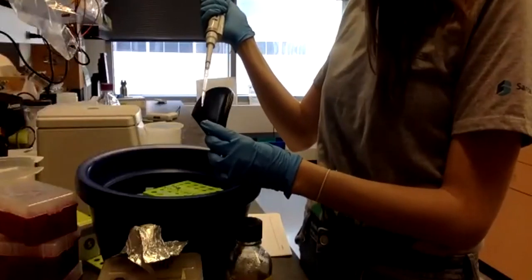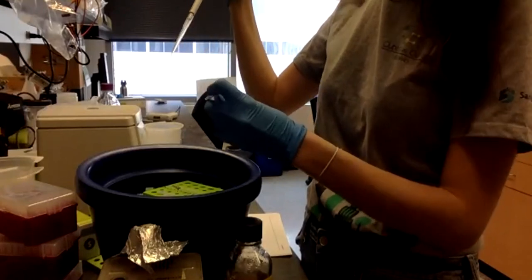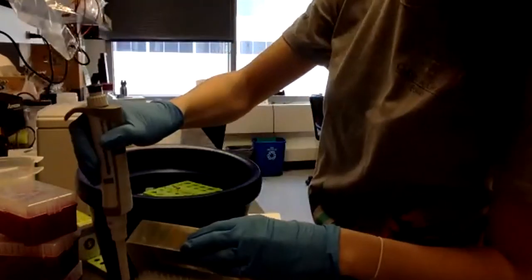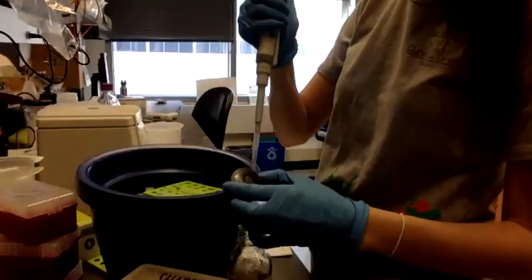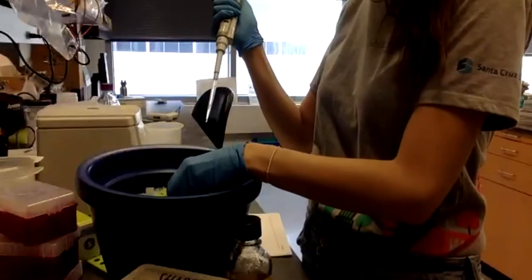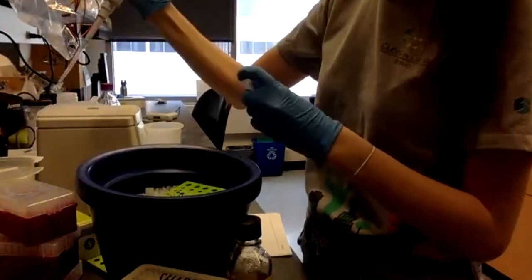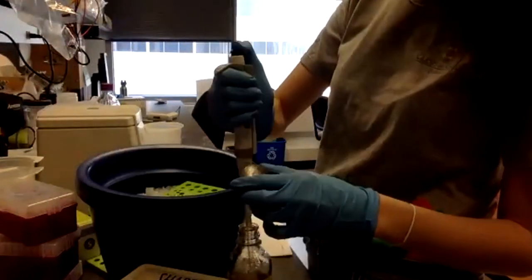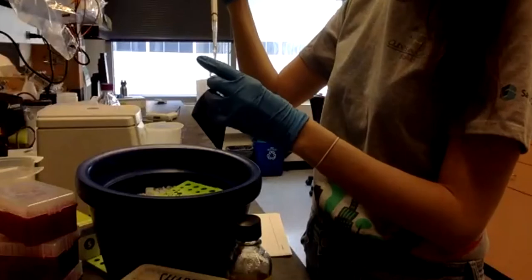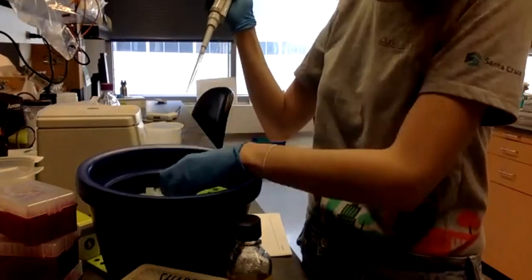Okay, let's add 250. We'll add another 250. 250 more. And the last one.